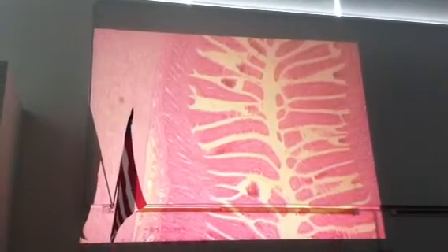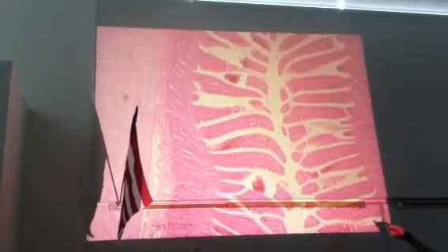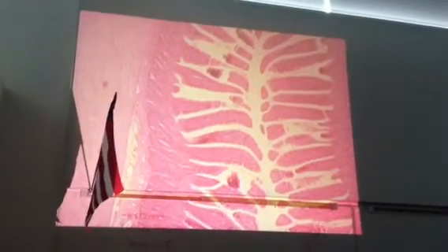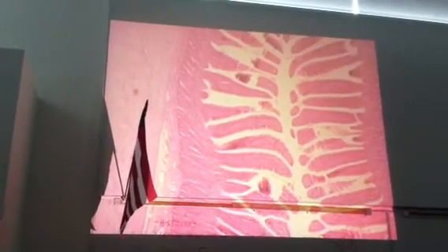If you're in the jejunum, which is what this is, then we have kind of rounded ends to the villi, simple columnar epithelium, and lamina propria. The villi end here, but the mucosa goes all the way to this point, and we've got crypts of Lieberkühn present. If we don't have anything special in the submucosa, we'll look around and see that. If we're in the ileum, the villi are stubby and block-shaped, and on one side in the submucosa, we've got Peyer's patches, unencapsulated lymph nodules there.